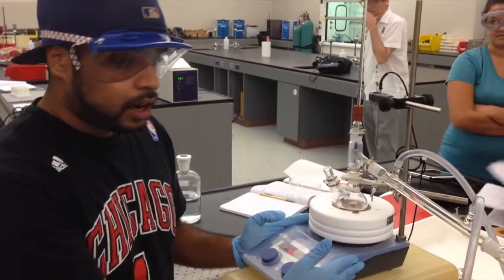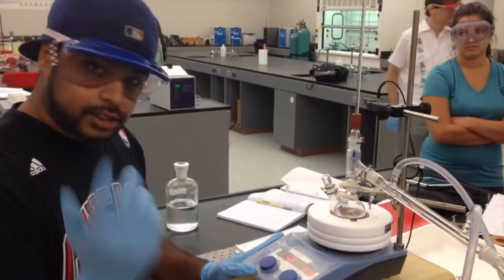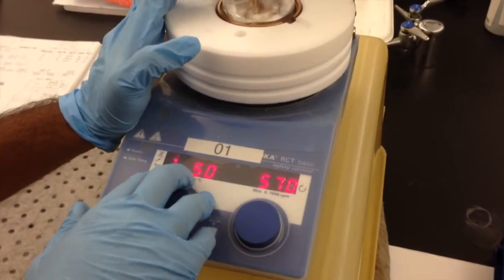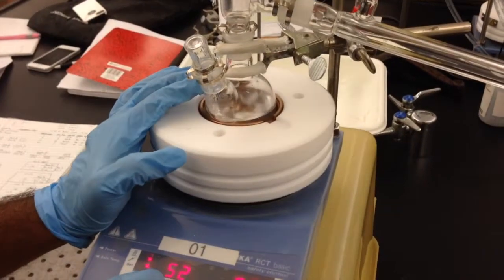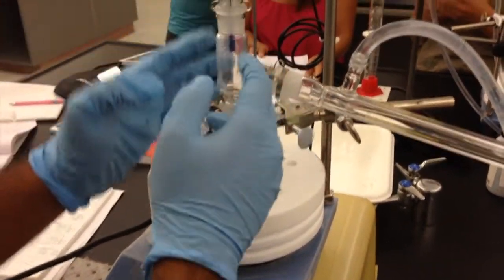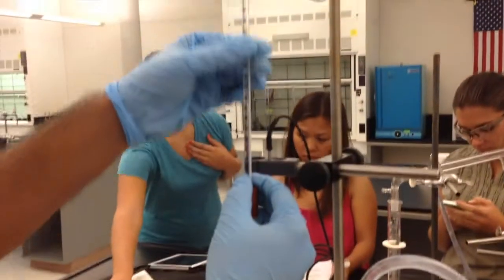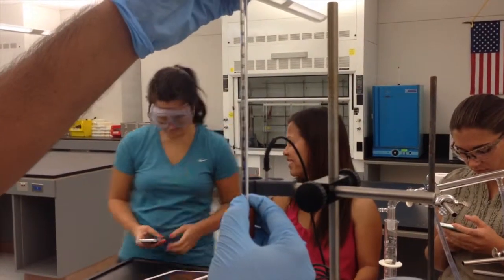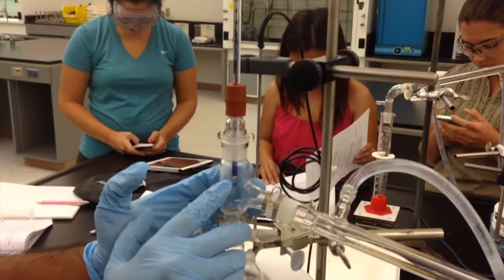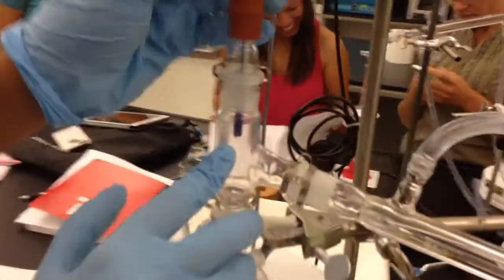Currently we are running our experiment right now, and as you can see, we have set the temperature between 100 and 120 degrees, and we also set the revolutions on here to keep this mixing. Now, as this is going through its process, this will start to evaporate. Once it evaporates and gets to this tube right here, we'll be able to monitor the temperature using this thermometer, I apologize. Now, what is important for this thermometer is to make sure that the end of the thermometer is right there by the beginning of the condensing tube.